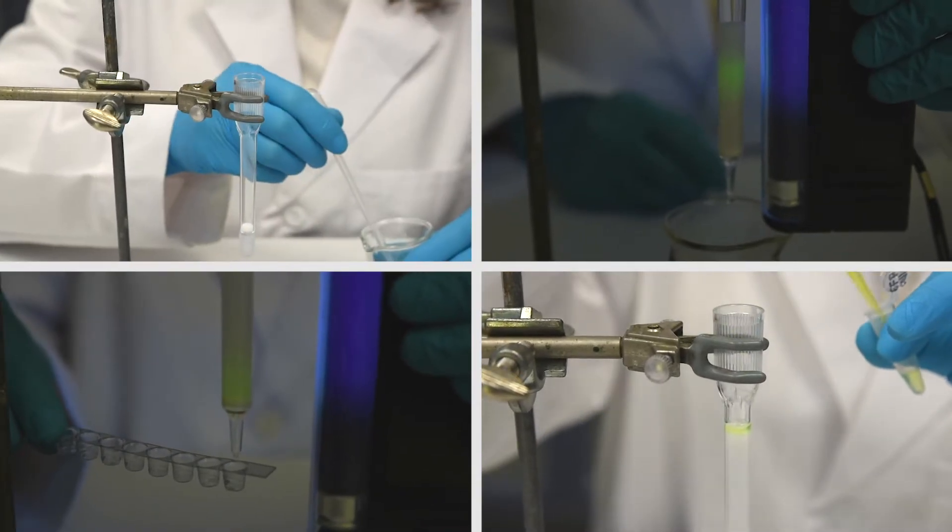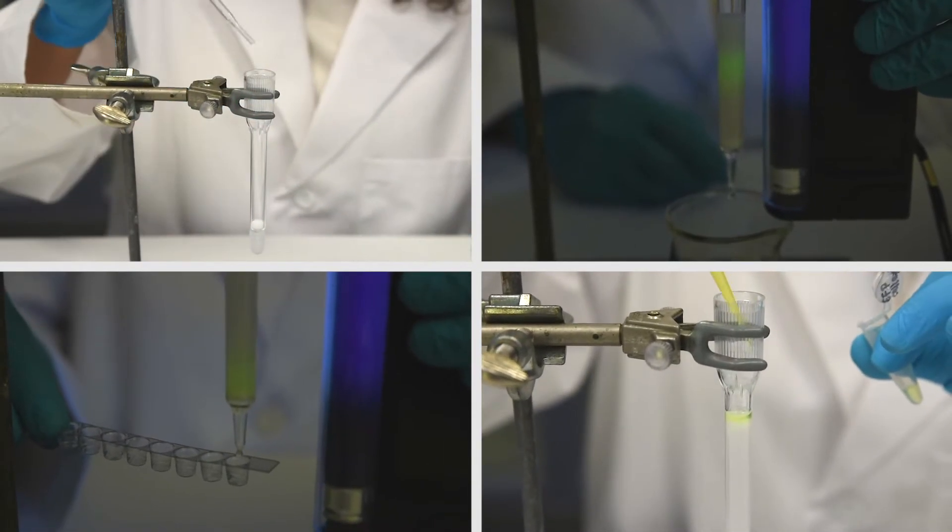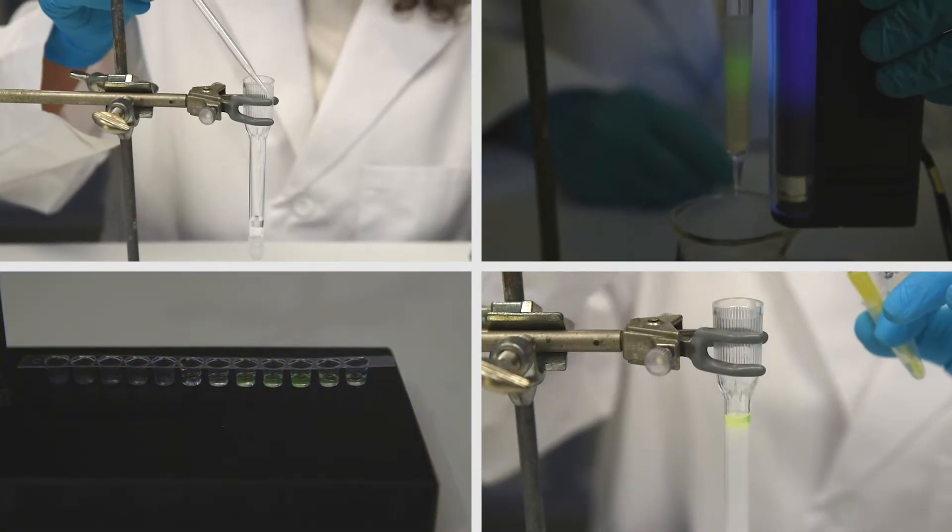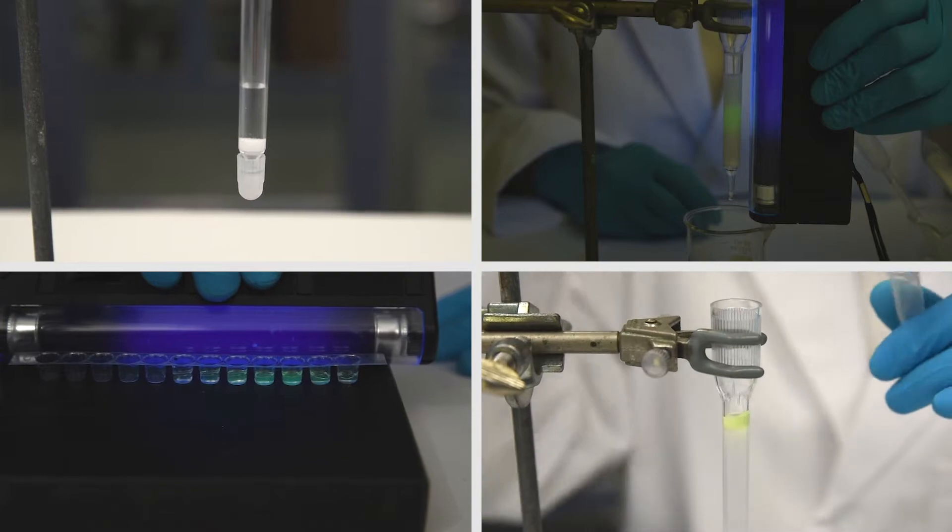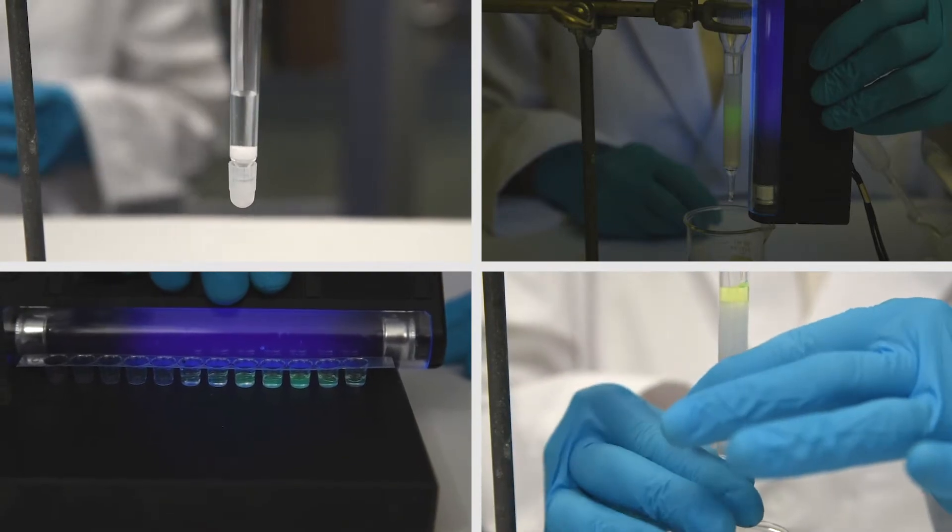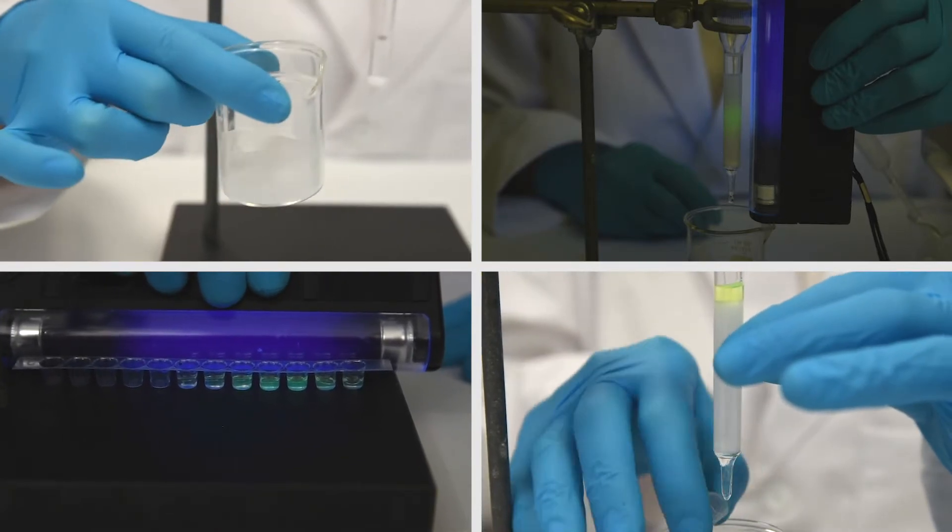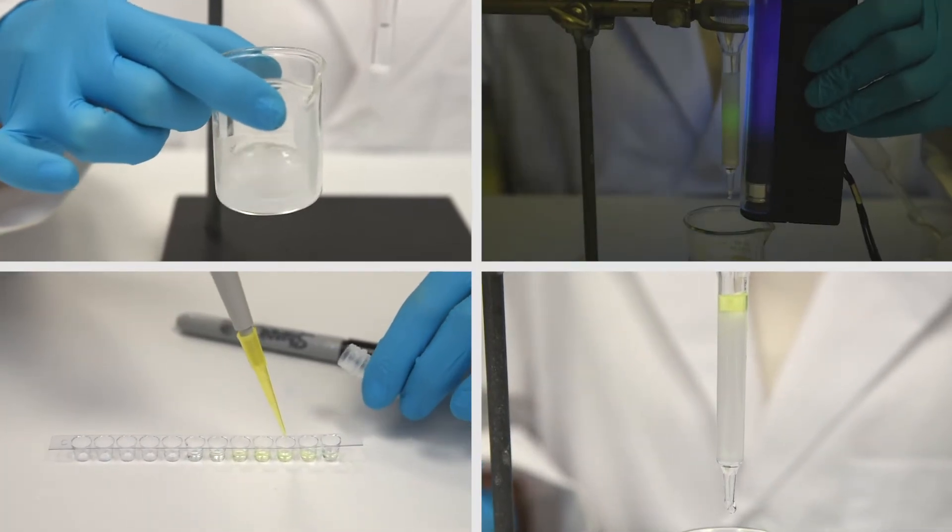First, columns will be packed with a molecular sieve matrix and equilibrated with a wash buffer. The cellular lysate will be run through the column and the GFP will be collected using a microtiter strip. Highly fluorescent fractions will be saved for analysis in Module 4.